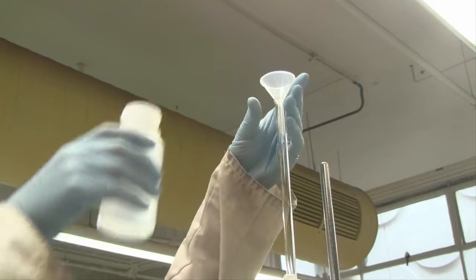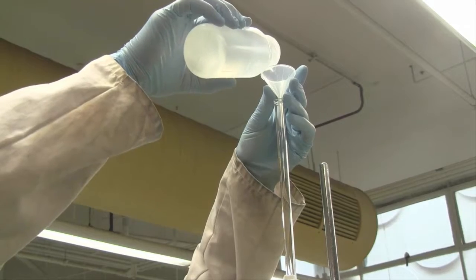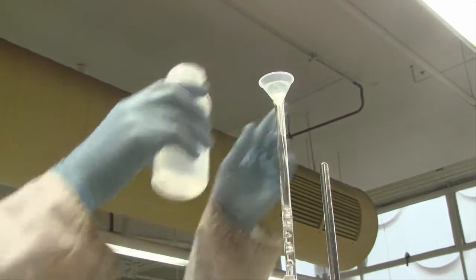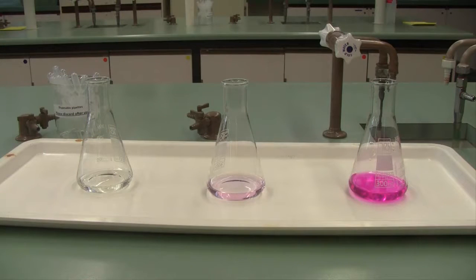Fill your burette with your 0.1 molar sodium hydroxide solution. And then you'll be using this titration in order to standardize, to determine the true concentration of the 0.1 molar sodium hydroxide.